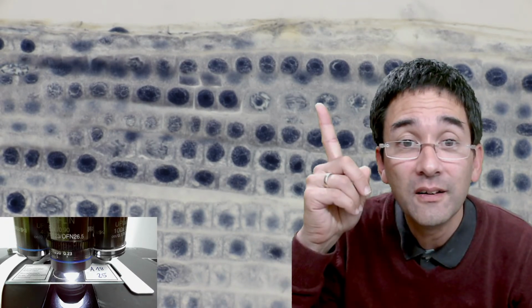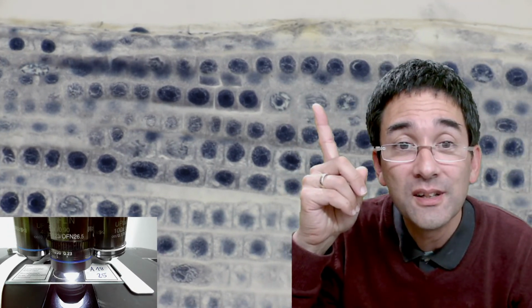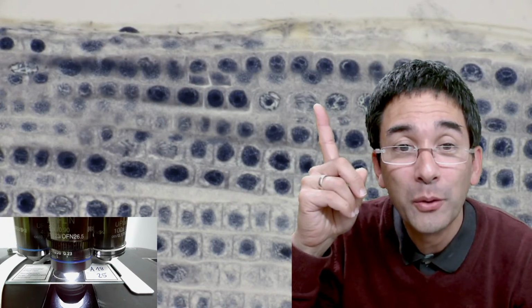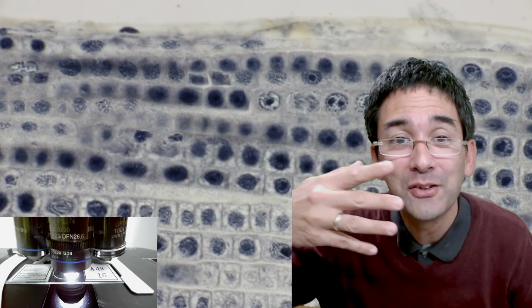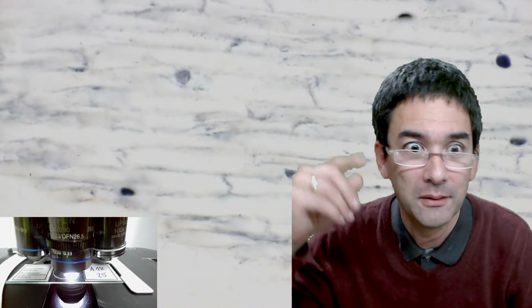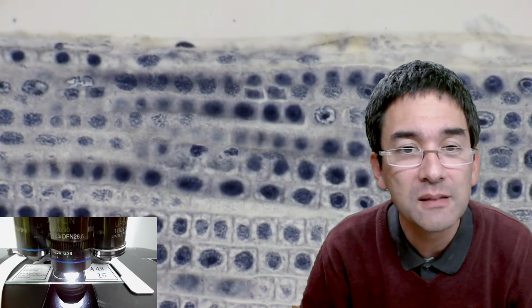Here, do you see this here? Exactly this one over here. Into which direction are the chromosomes pointing? Yeah, they're on the outside, pointing inwards. Anaphase. Oops, I bumped against my stage. See, when this happens, you have to find it again. Okay, again, I've been here already.